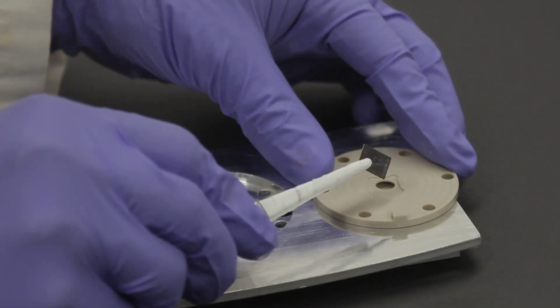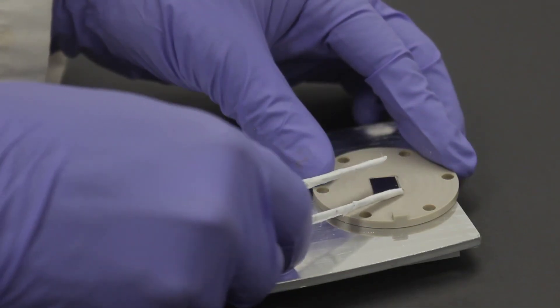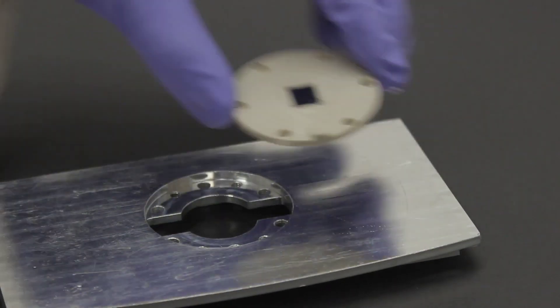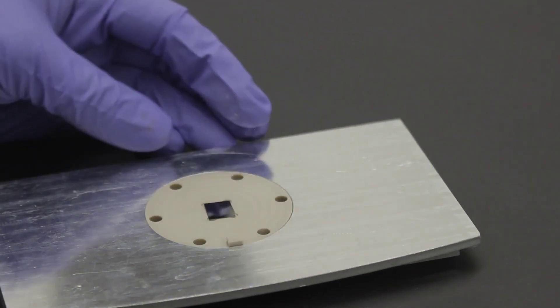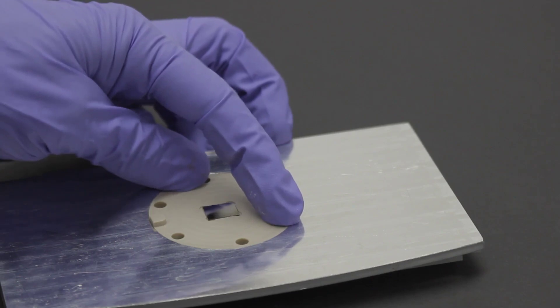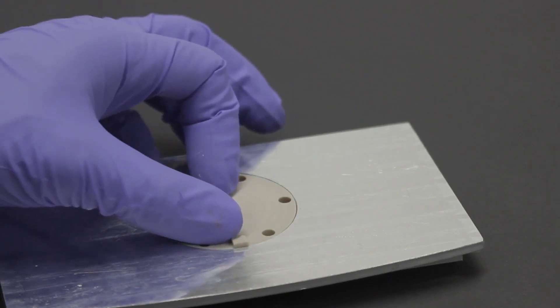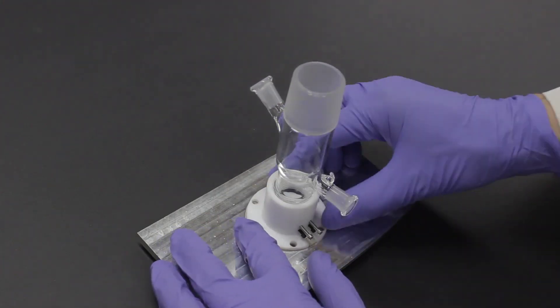After selecting a wafer, place it groove side down in the wafer holder and place the entire assembly into the top plate. The grooves can be oriented parallel or perpendicular to the beam path, and in most cases, either orientation should work approximately equally well.